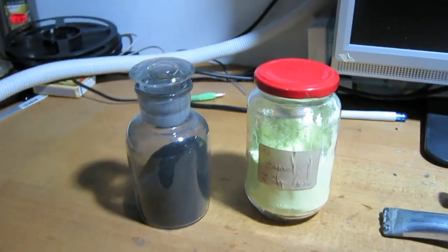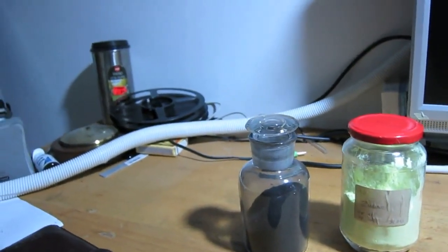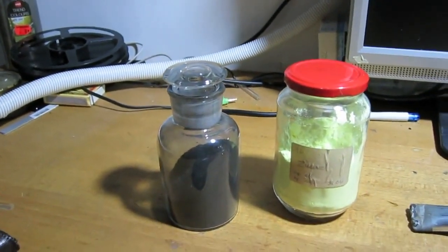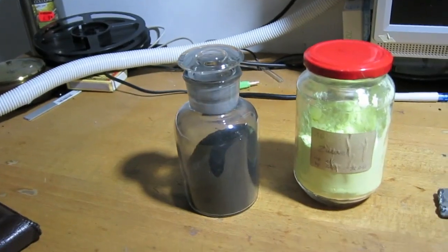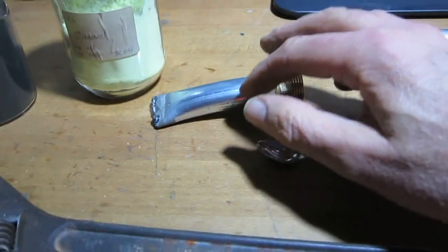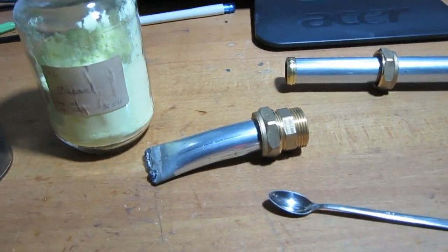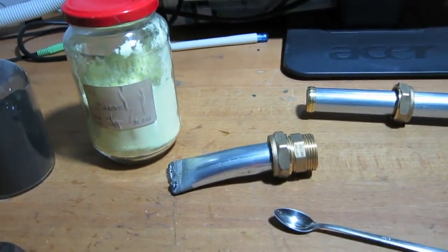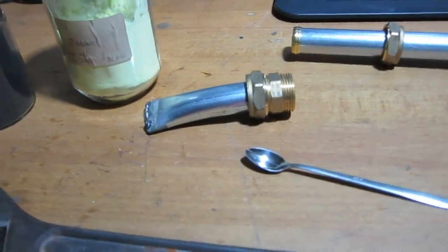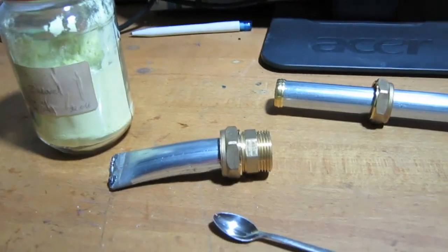from the elements. It's just by heating the elements together in the retort at 800 degrees Celsius, and then capturing the CS2 gas into a very cold test tube under a very cold bottle. This will be the retort filled with sulfur and carbon, about five parts sulfur to one part of a mass of carbon, but I will take a little bit too much carbon to prevent excessive sulfur vapors.